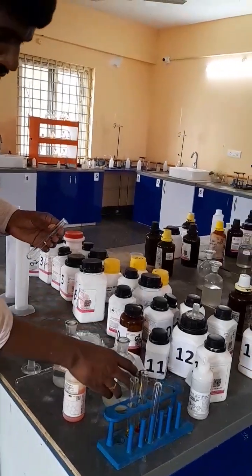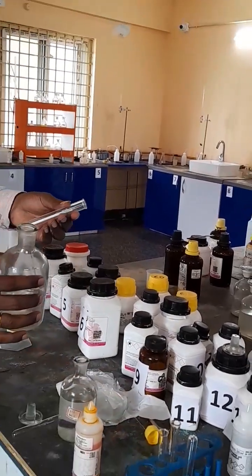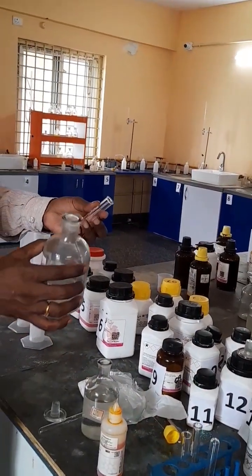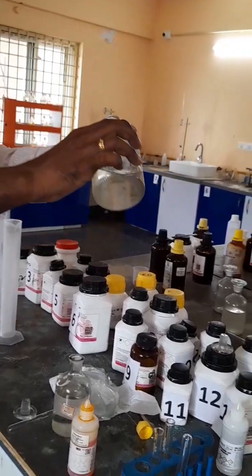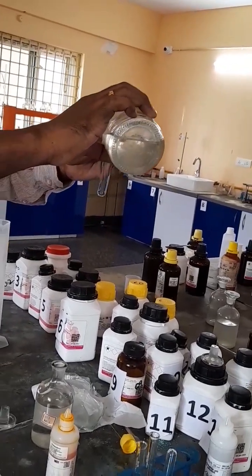In this video I will be demonstrating how phenolphthalein gives no color in an acid as well as a pink color in an alkali.